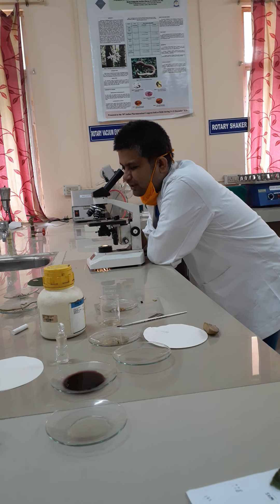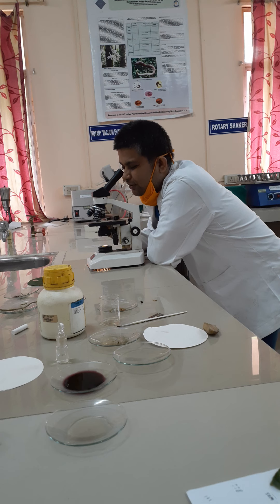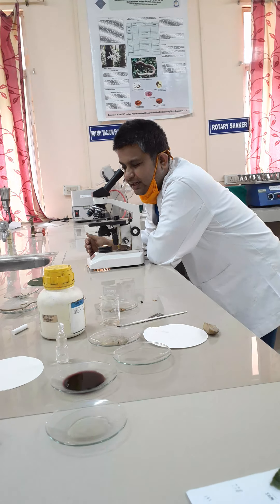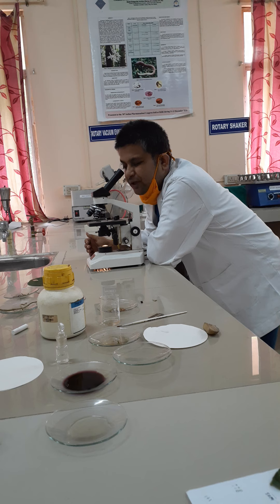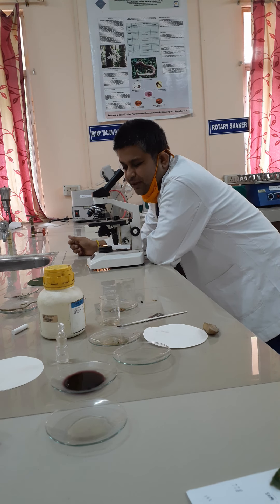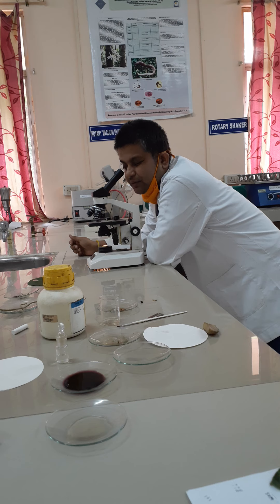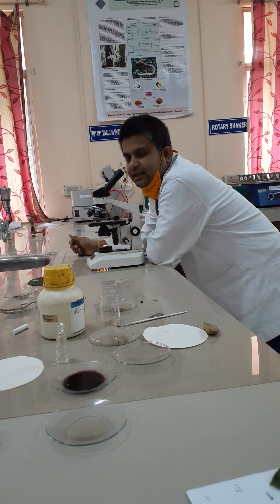Let us see what we can find here. You can observe both the lamina and midrib parts. The lamina part mainly consists of mesophyll, which consists of both palisade and spongy parenchyma. In the upper epidermal part you will find unicellular covering trichomes; glandular trichomes are absent in senna.